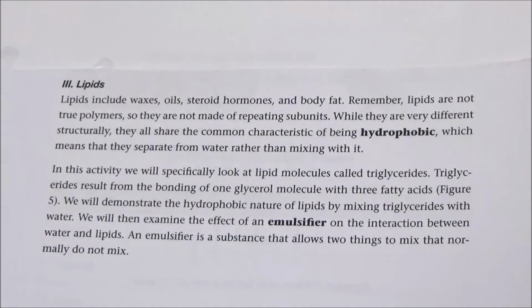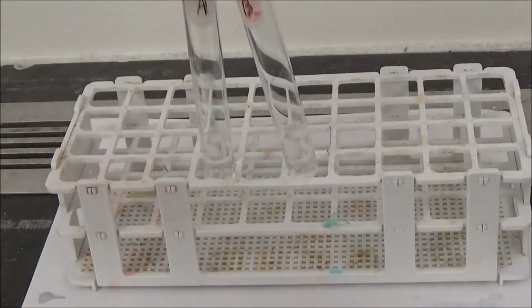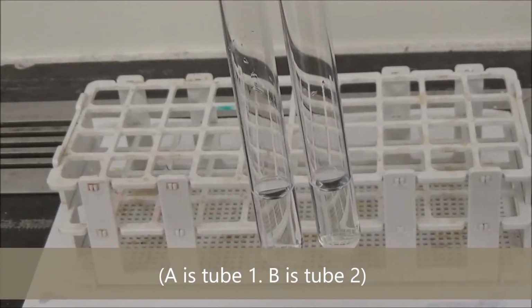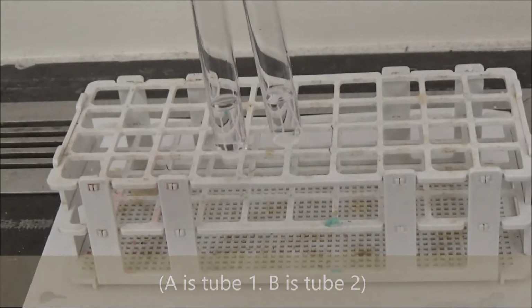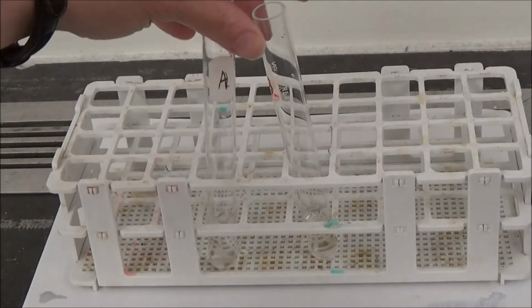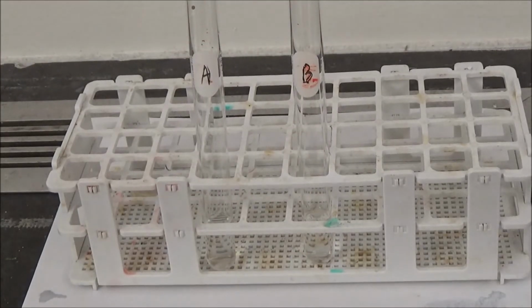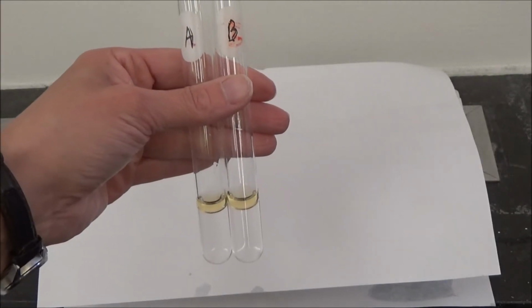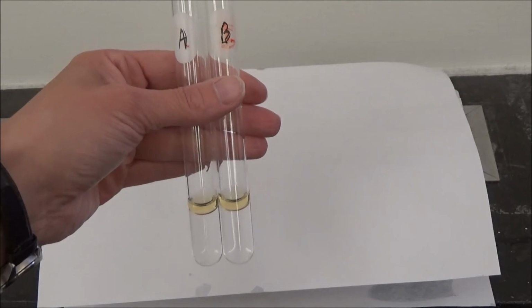So we're going to look at triglycerides. In this case, we're looking at sesame oil. And we're going to look at the hydrophobic nature of triglycerides and see what we can do to make this oil interact with water. So we have 2 tubes, we're calling them A and B, and we've added 3 milliliters of water to each tube. Now we're going to add 15 drops of sesame oil to each tube. So I've added 15 drops of sesame oil to each tube.